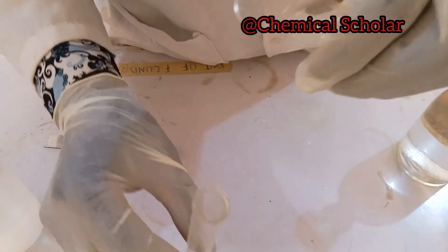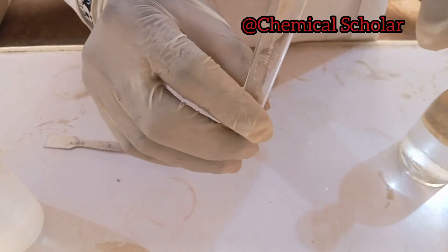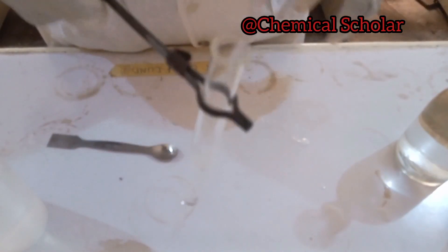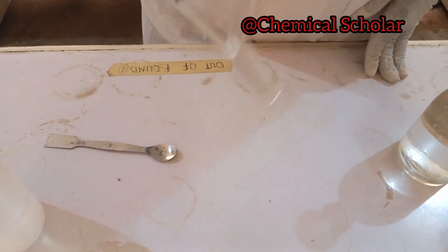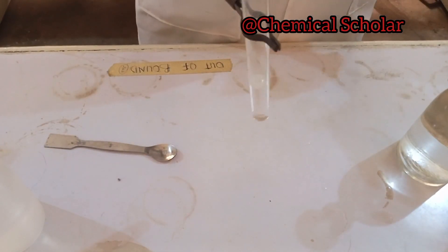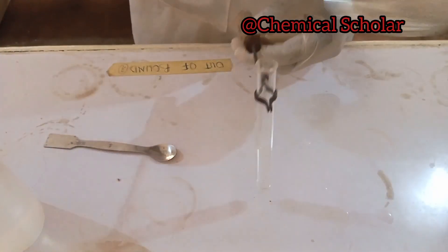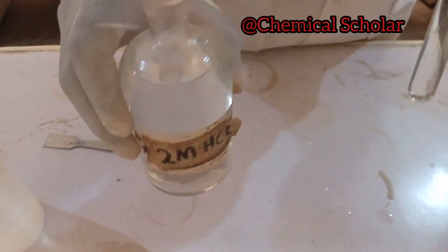You can see that the salt has dissolved. We pour a sample of the salt solution into a test tube and we are going to test it with dilute HCl to see the reaction. Here is the dilute HCl.